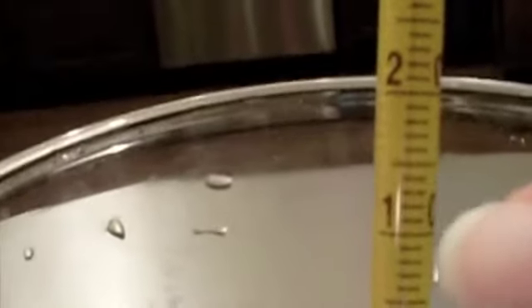Last thing to remember is that, remember last week when we were reading our graduated cylinder and we talked about the different integers and how you have to know the integers before you can actually read it. So this one, each little line goes up by 1. So you have 0, 1, 2, 3, 4, 5, 6, 7, 8, 9, 10 degrees Celsius. Okay, so it's going to be important to remember so you can read the thermometer, okay? I believe that's it, and we should be ready to begin.